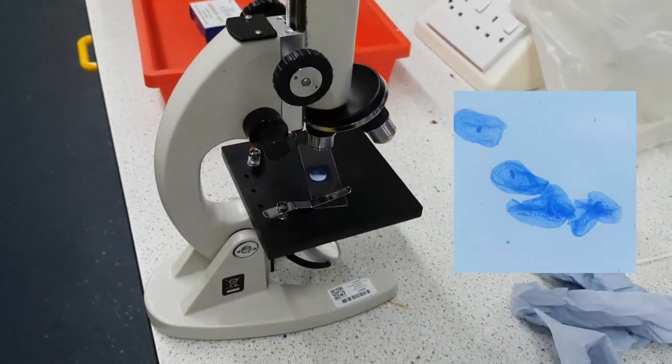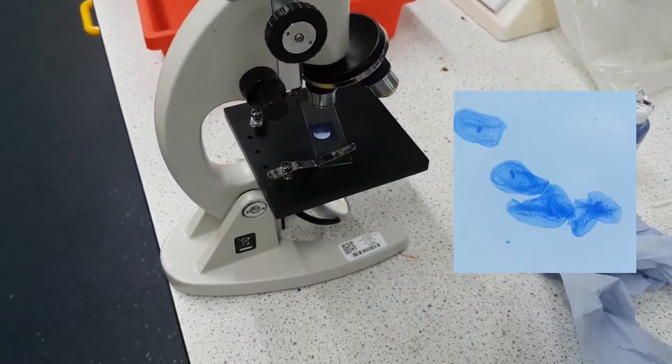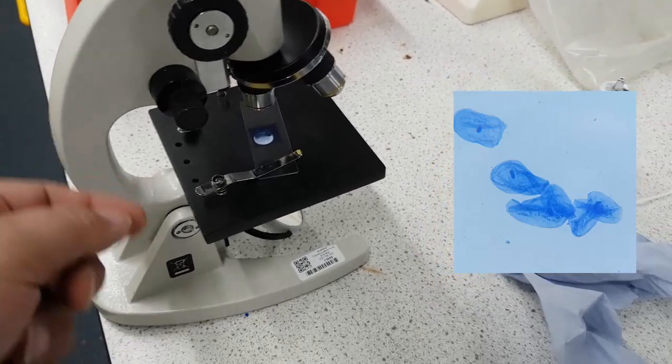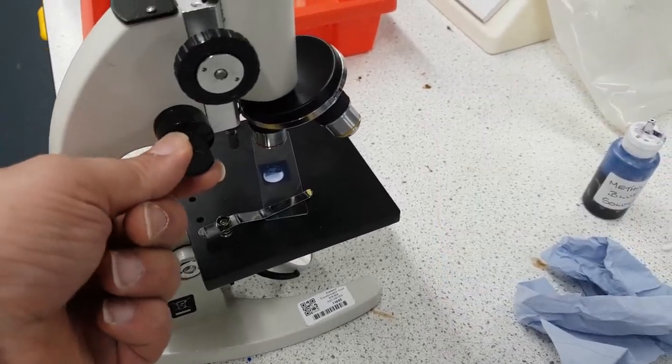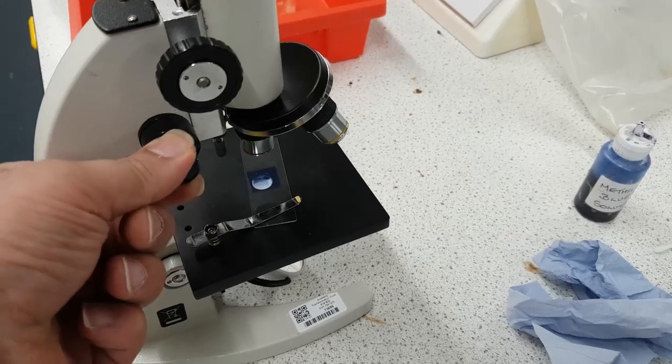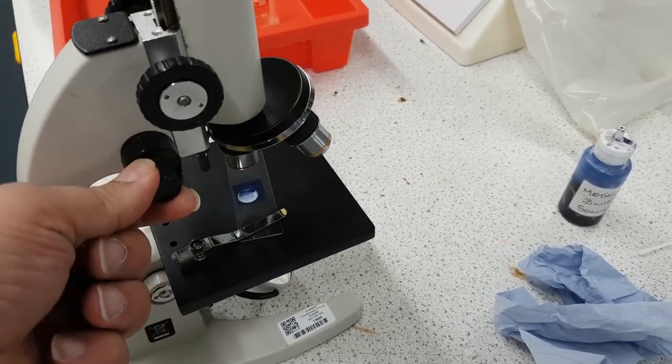I'll put a picture up at the end of this to show you what you get. Now once you've found a nice image, you can focus it more using the fine knobs.